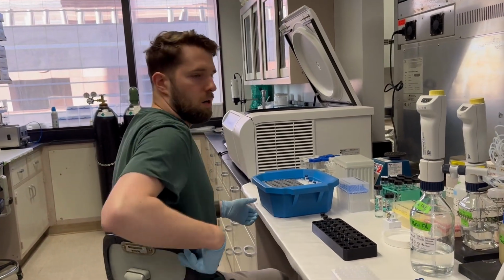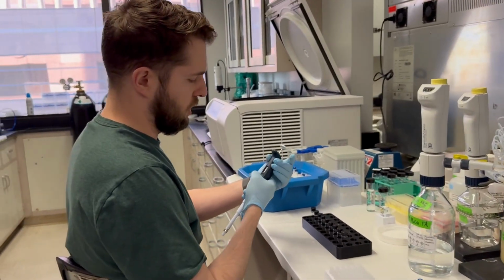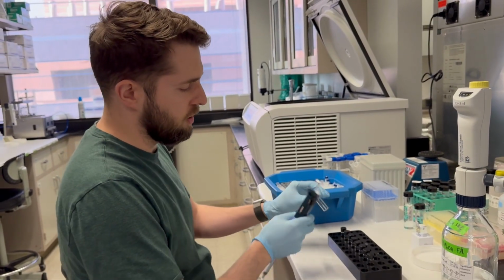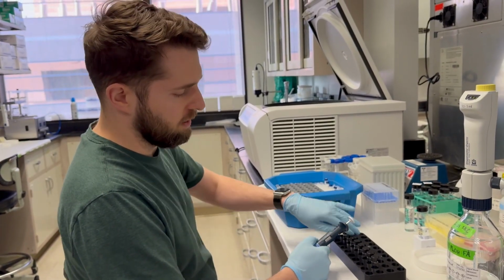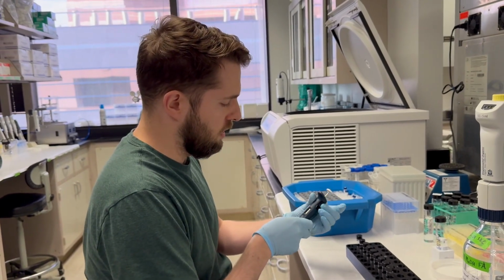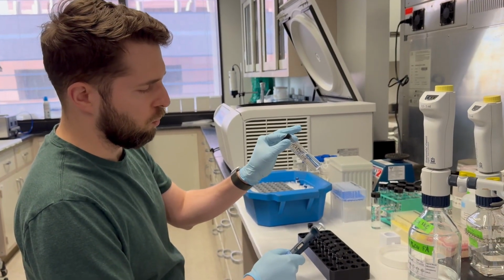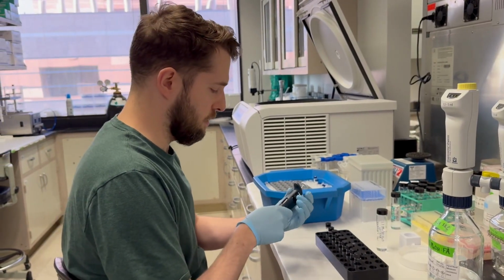So let's get our P1000. The first thing I'm going to do is prepare all of the subsequent vials. Because we're moving a third of the stock vial into the next vial, and then a third of that into the next vial, we do everything out of 900 microliters just to make the math easy. So I'm going to put 600 microliters of our solvent, which is 1-to-1 methanol to water plus a little bit of formic acid, into all of these to prepare them ahead of time.